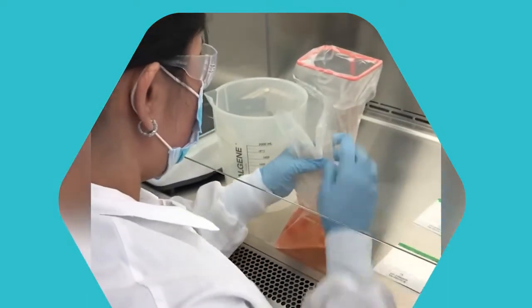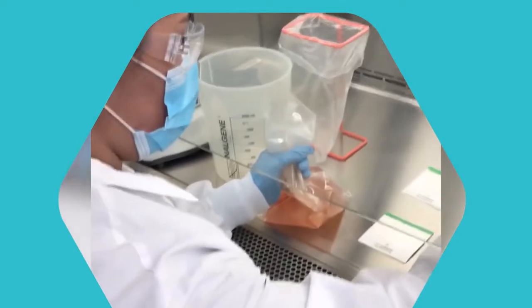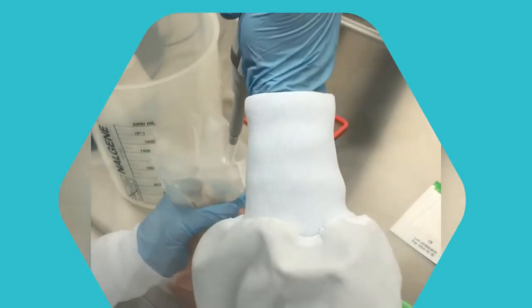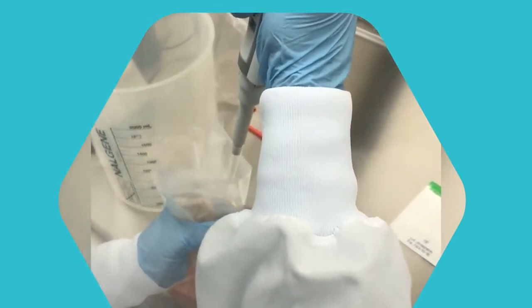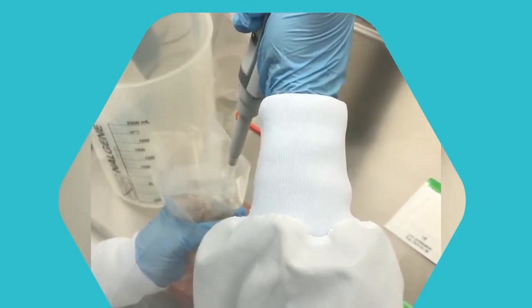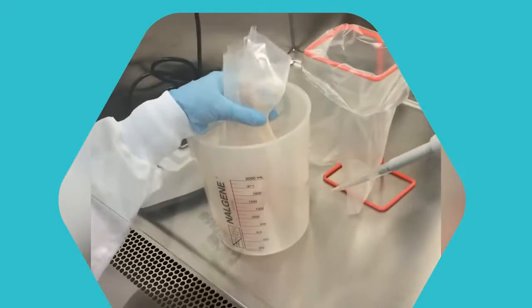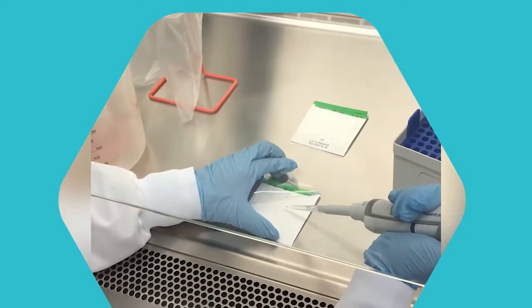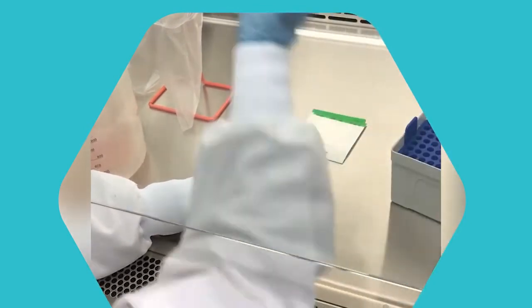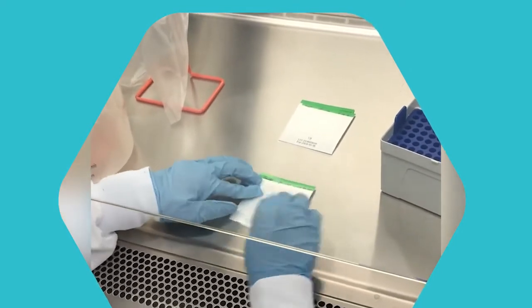All right, got my sample here. I'm going to push this down so the solution can come up. I'm going to go in there, draw one milliliter of my sample up. This is the pad that I'm putting my sample on. And then we're going to put this aside.